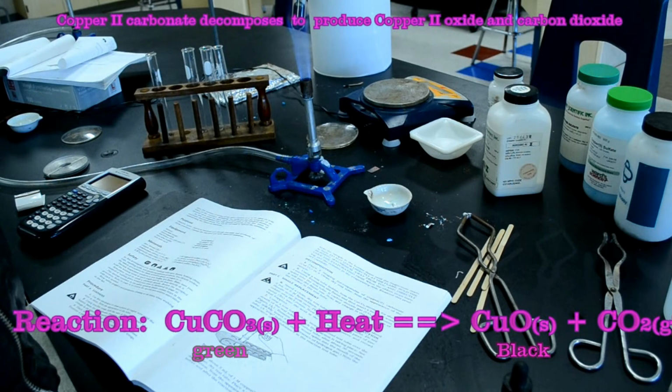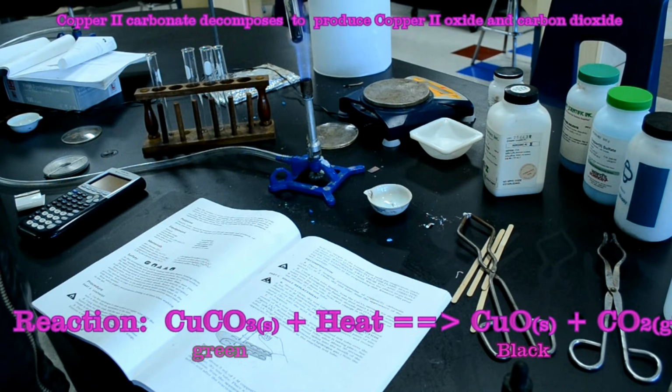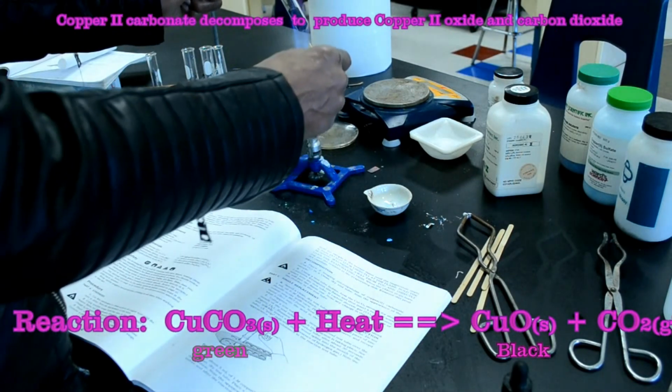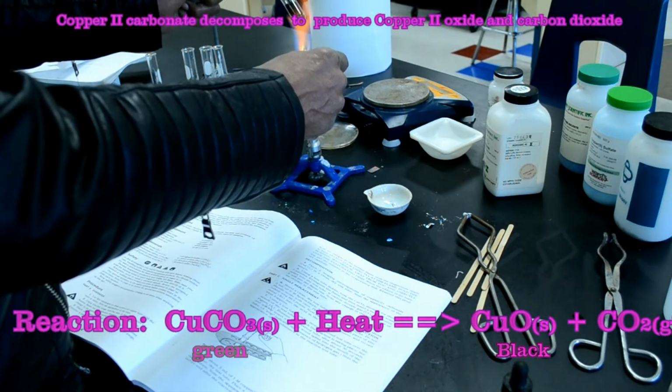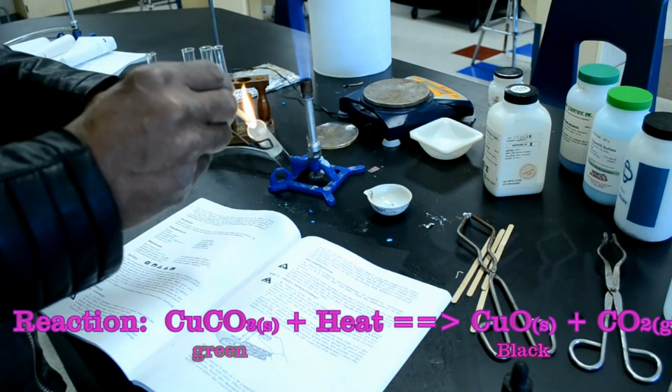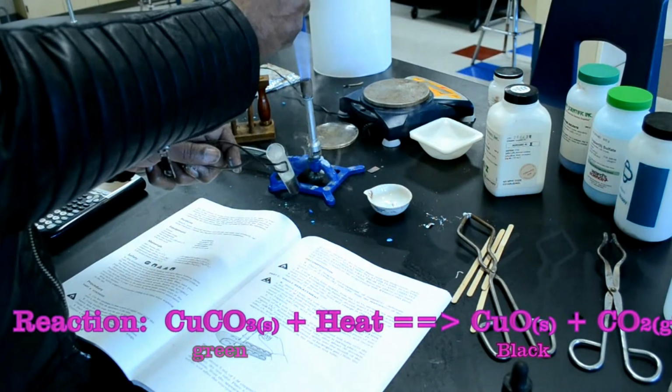And we can also see that the sample is actually moving up in the test tube. So now I'm going to light my wood splint and place it in the test tube, and the flame immediately goes out.